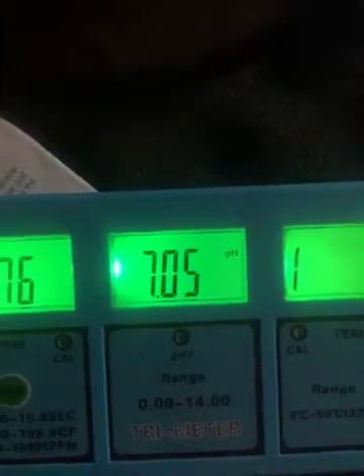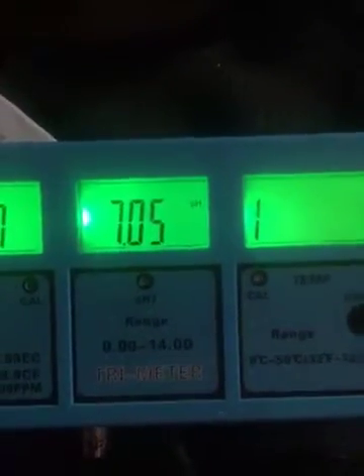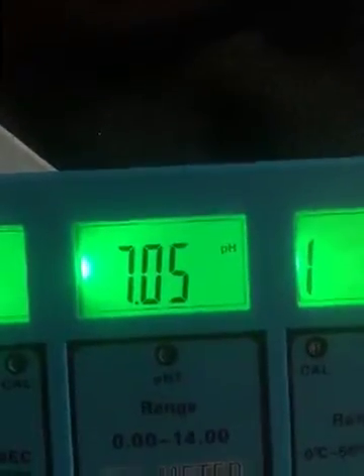No change. Temperature isn't hooked up. The EC PPMs isn't hooked up. Obviously, if you're familiar with the pH meter, when you move it from the test solution that calibrates it to 7, down to a hundredth, into tap water, which is typically 6.3 to 6.7. No change. Complete garbage.